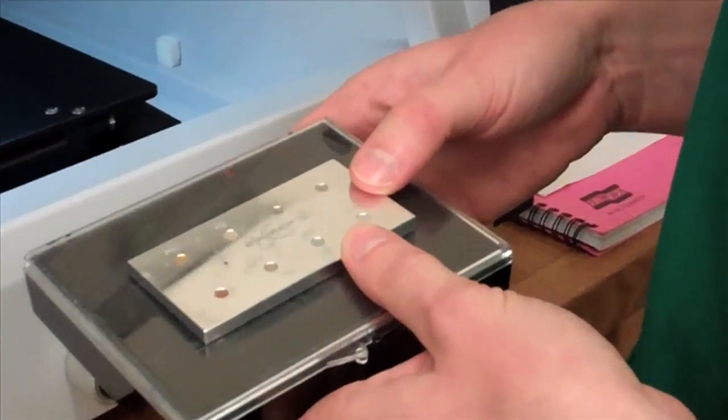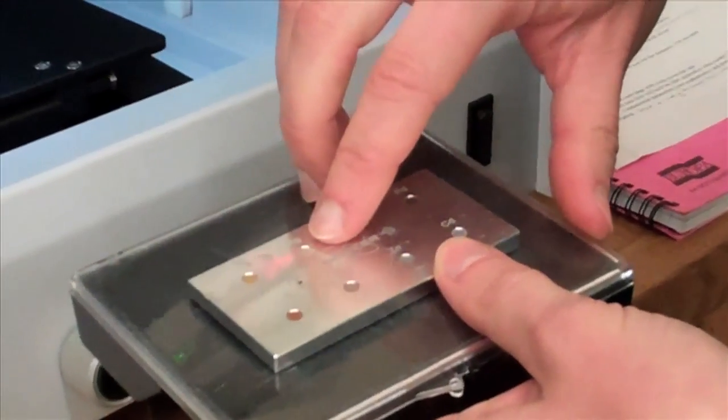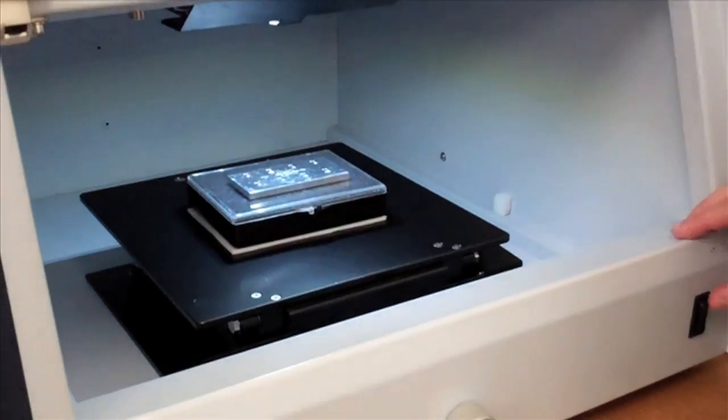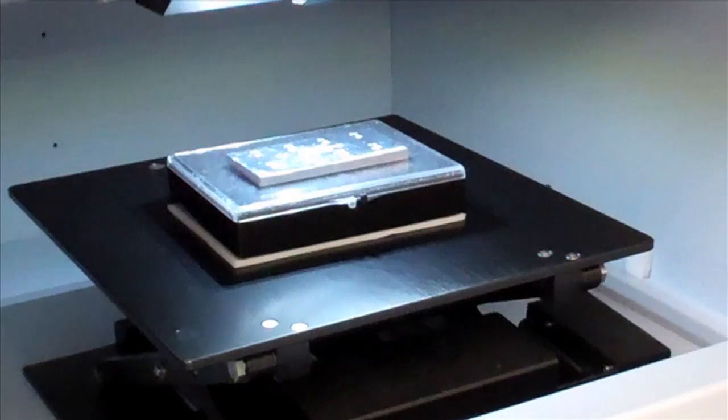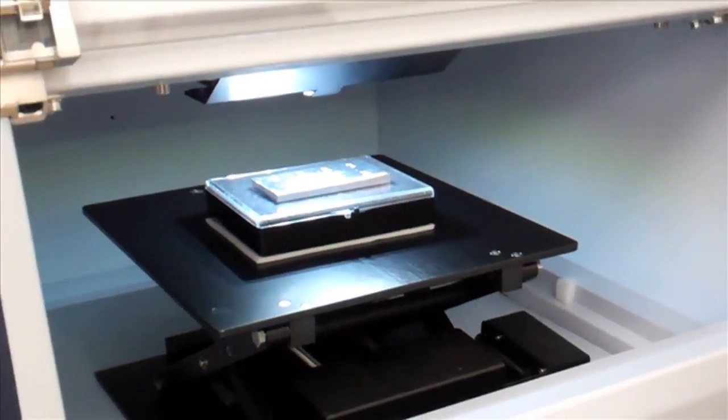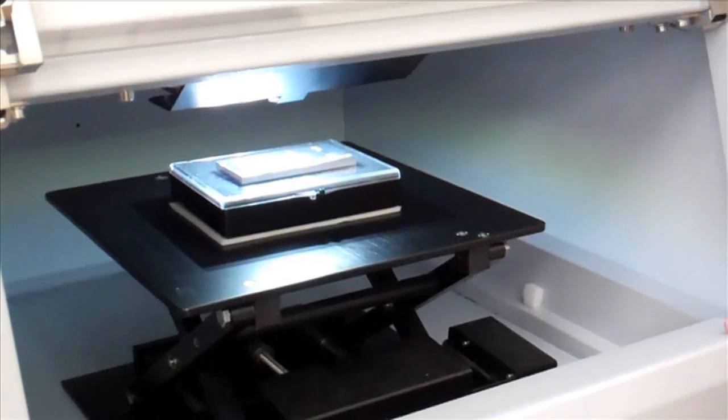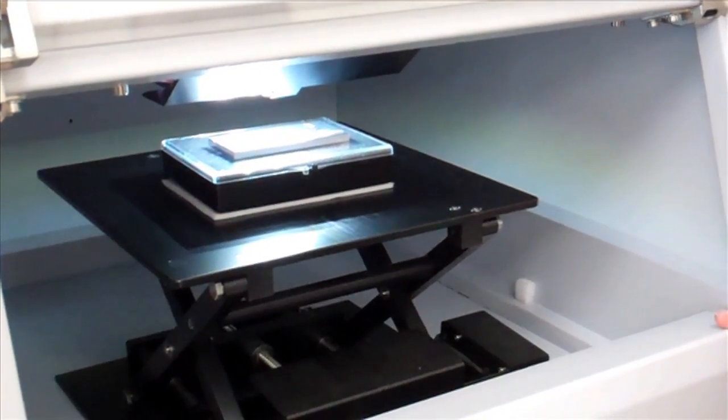So here we have our known standard and we're going to use silver, which is right here. And then we raise the platform so that the object is positioned at the right level for the X-rays to be read.